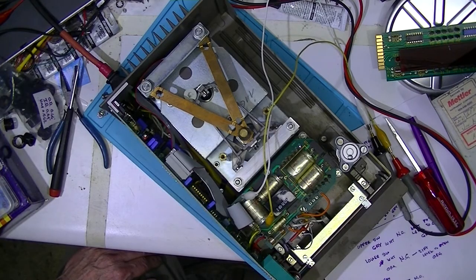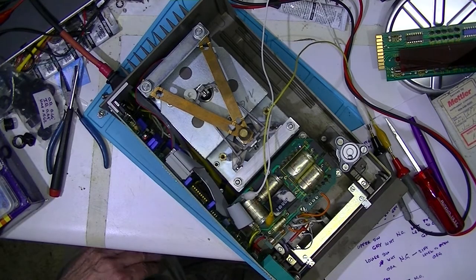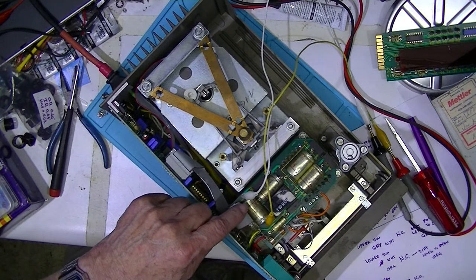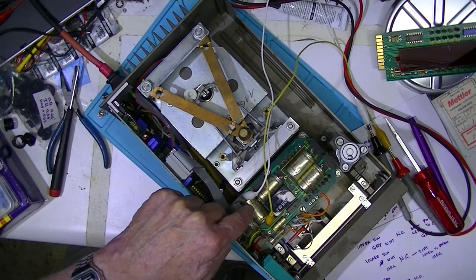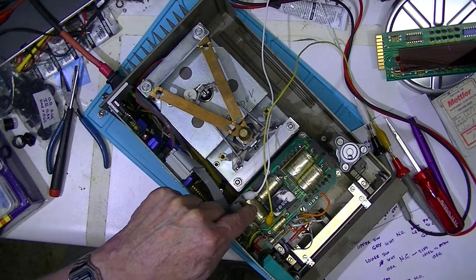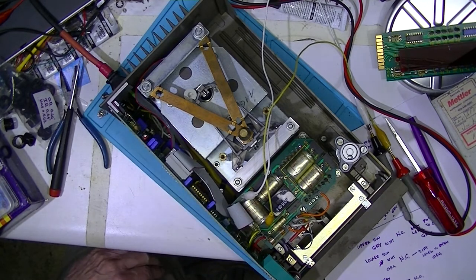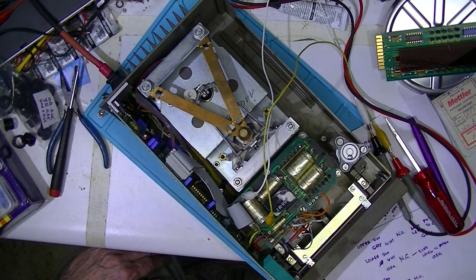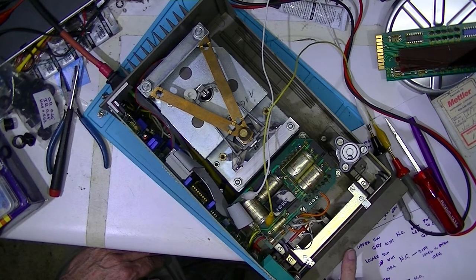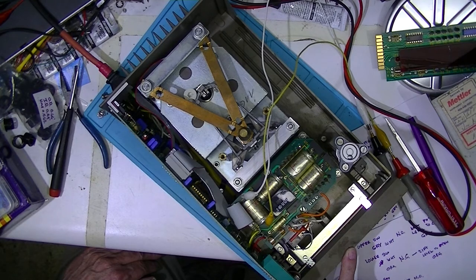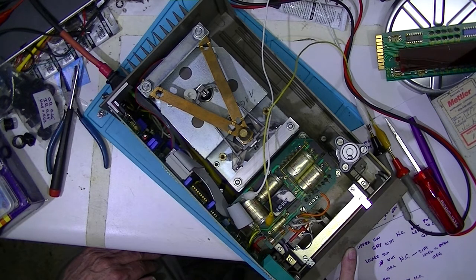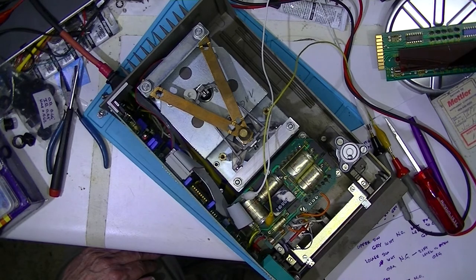I'm using the bench meter. I've got these clips across what appears to be a low voltage power supply capacitor, and when I press down you can't see it but I get 31 volts on my bench meter. Soon as I lift up it goes away.